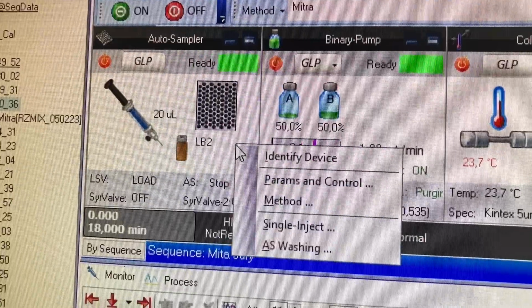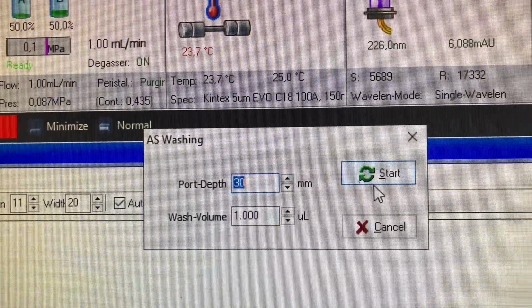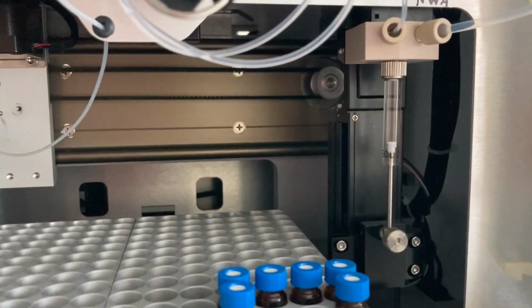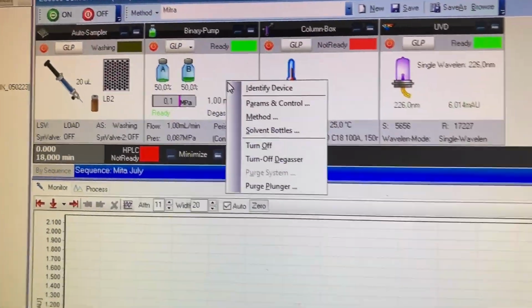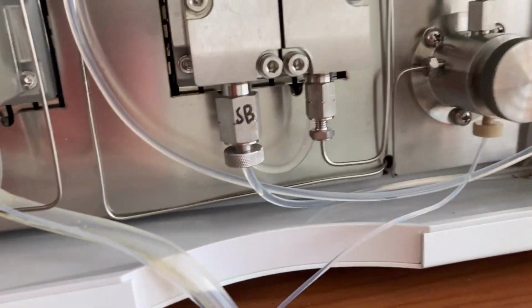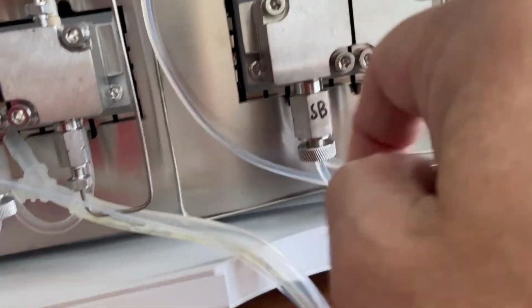And while that's going, I'm going to do the needle wash. There we go. And this should start pumping here, yep. Push the needle, that's all good. I'll do that about 3 times, show you one more time, because I'm going to do this about 3 times. And start her up again. And then eventually, there shouldn't be a lot of air to be seen. Give it a wee flick. See the bubbles.